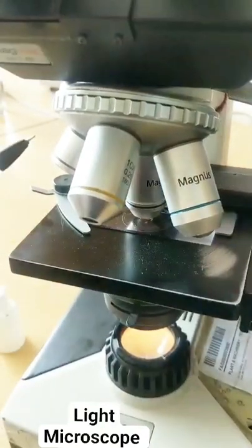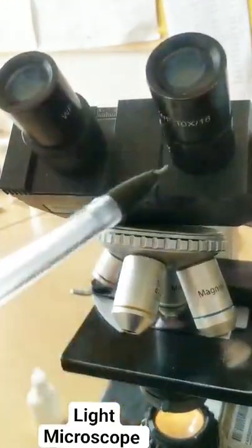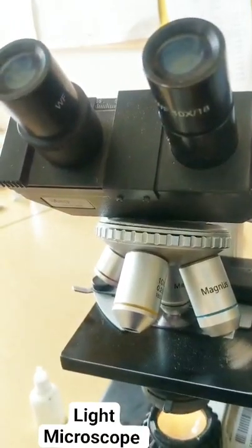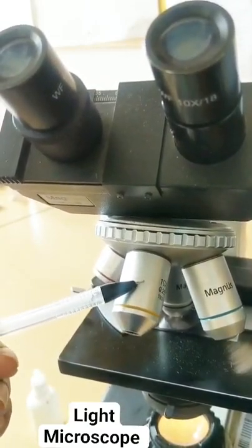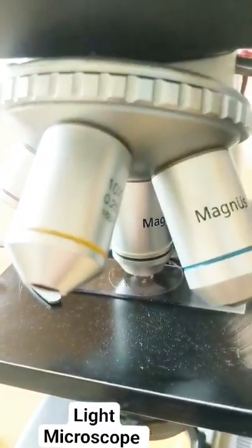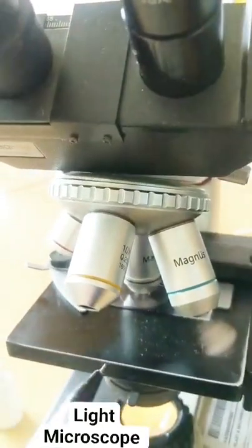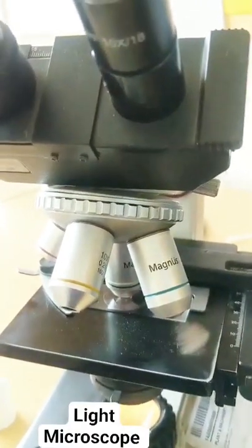After the objective lens, you have this last one from where you're viewing. This is a binocular vision — you can adjust it as per your intercanthal distance. What is the magnification written on this? 10x. So this is the eyepiece. The final magnification you get is what you multiply: the objective lens you are using by the eyepiece, which is always 10x. For example, using oil immersion — the magnification is 100x — multiplied by the eyepiece 10x gives 1000x. That's the maximum magnification you can get in this light microscope.